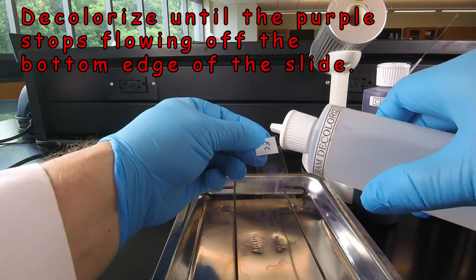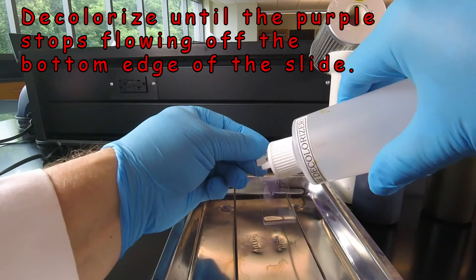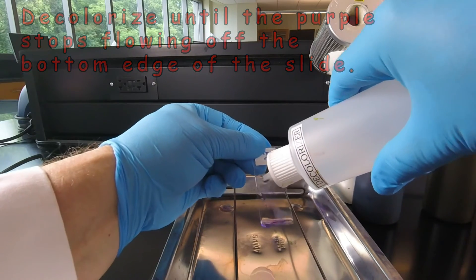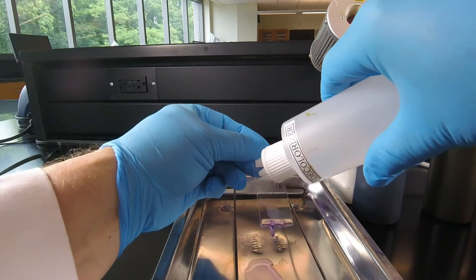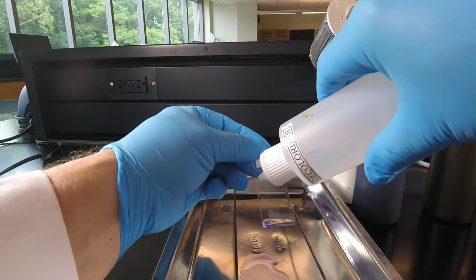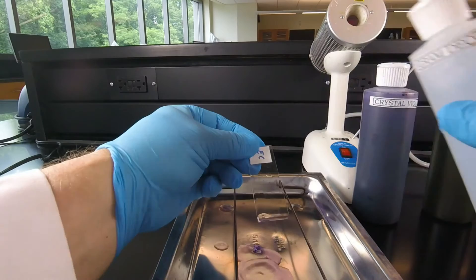So we'll start adding our decolorizer, and we see that purple's coming down, purple's still coming off, purple's still coming off. And now it looks clear.